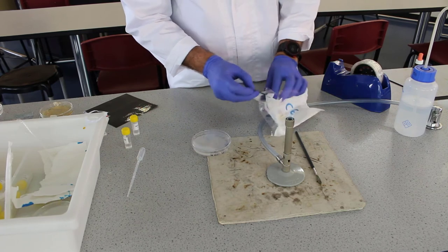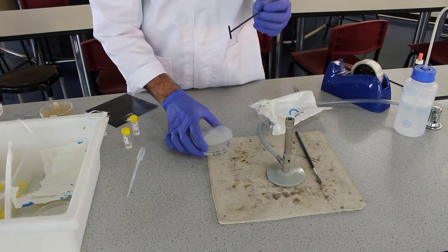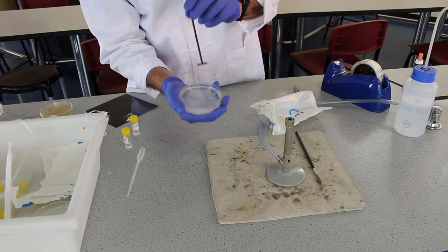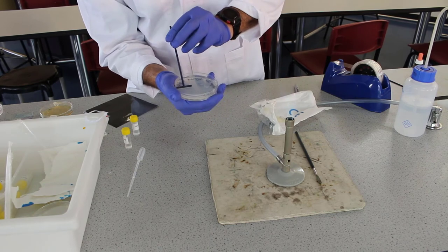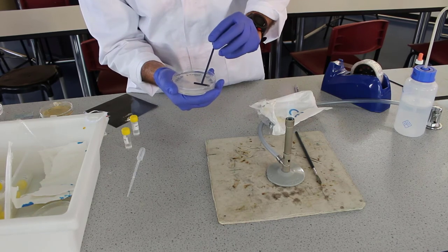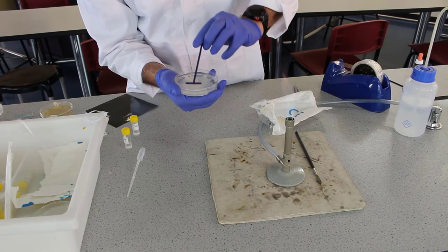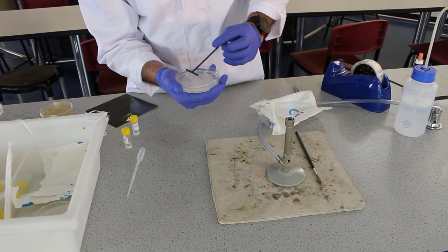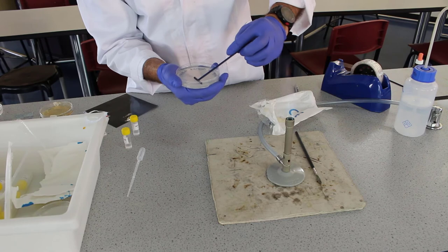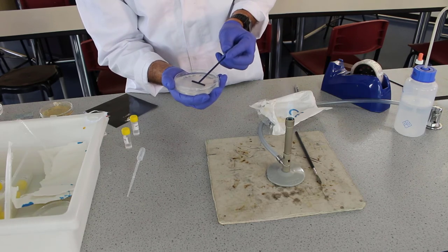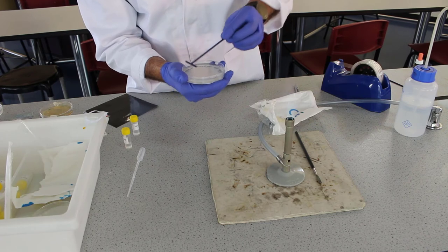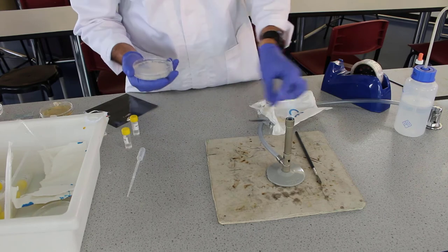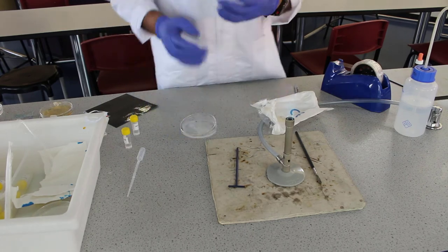Grab a new tea. What we need to do is spread our bacteria around the whole plate. Be careful with the agar that you don't tear it. We're trying to spread across the whole plate. Once you've done that, we can just leave it to dry for just a couple of minutes.